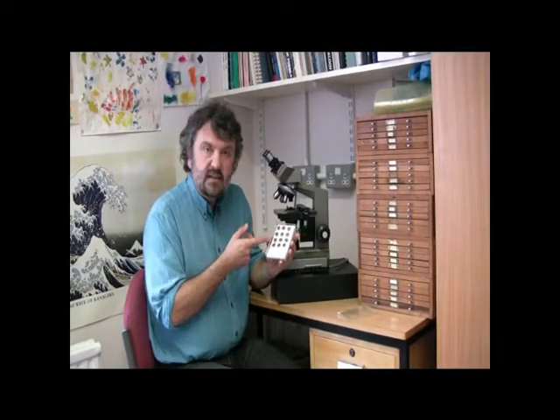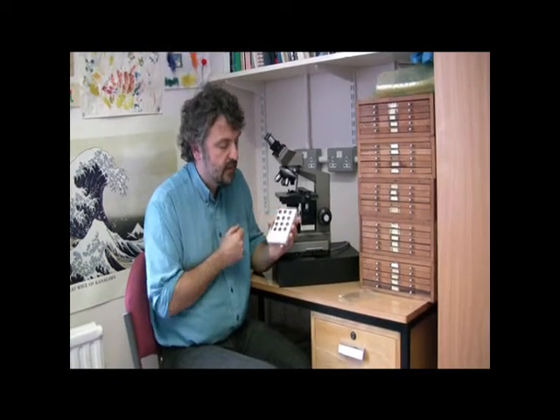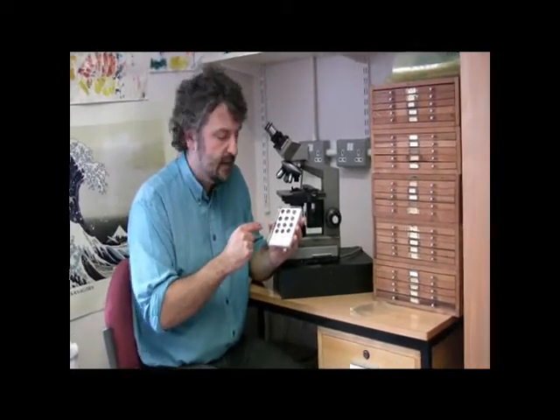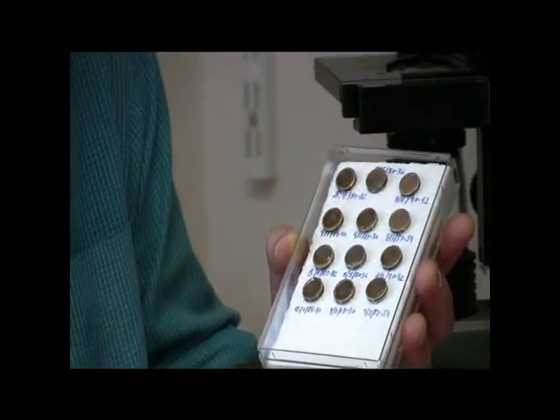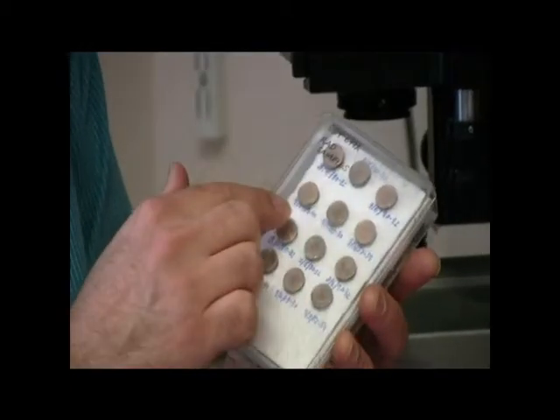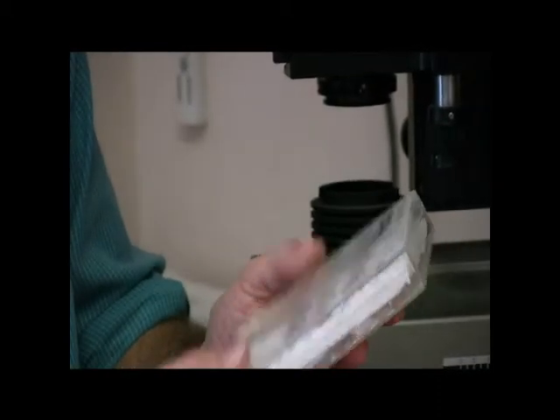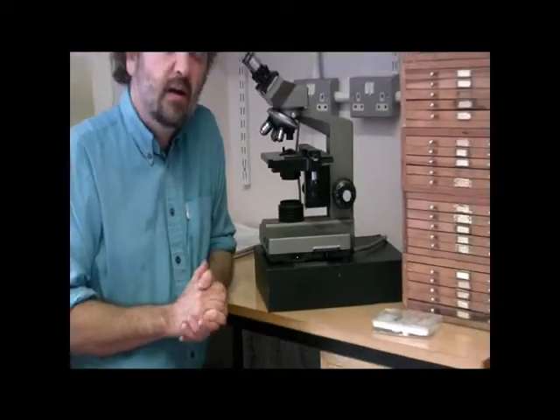In this case, you might be able to see that the coating material is gold, but there are other coating materials you can use as well. You need a sputter coater to actually coat the fossils. For each one of those stubs that are going to be used for the SEM, the full label of the core and the section in the core and the centimetre interval for each one of those samples is written on there very carefully. We can see from the cover that this particular suite of samples are from Ocean Drilling Programme hole 677A. So SEM is one way of looking at radiolaria.